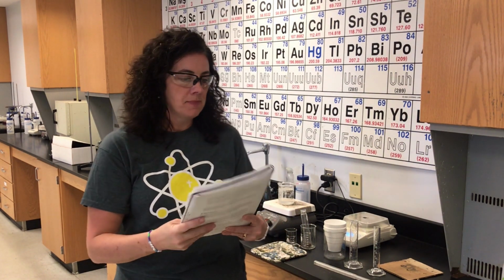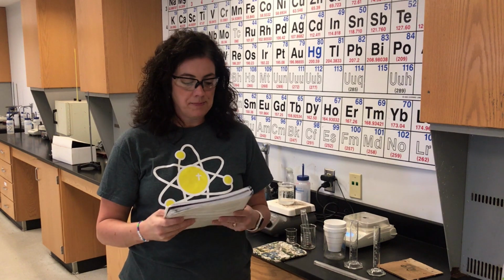This lab goes along with chapter 5, because it's heat and chapter 5 is thermochemistry. So I'm going to follow the procedure in part A on page 99. We're only going to do part A.